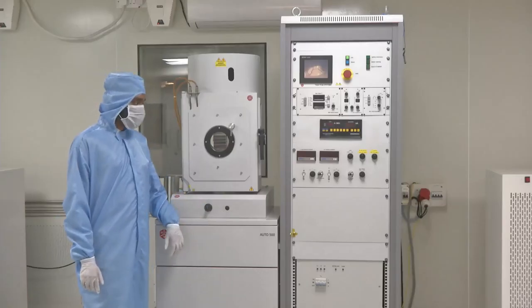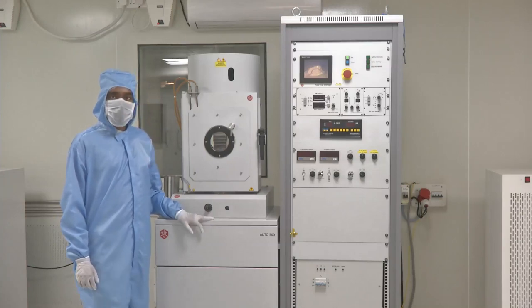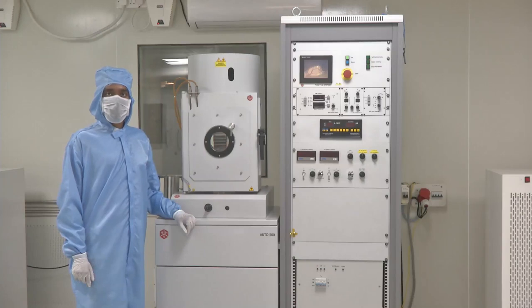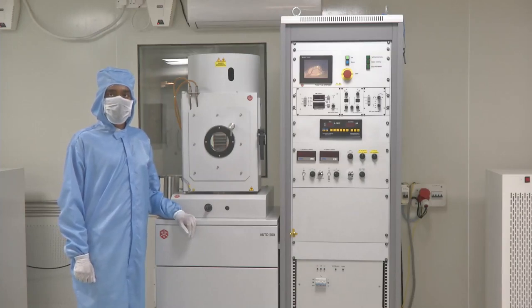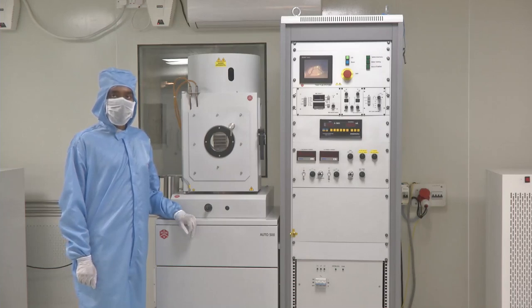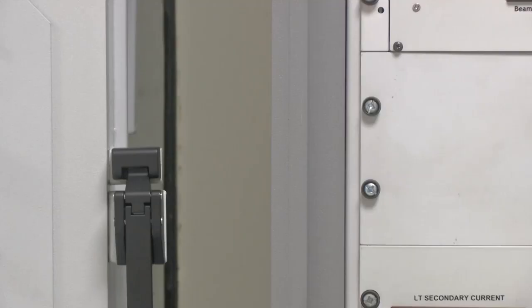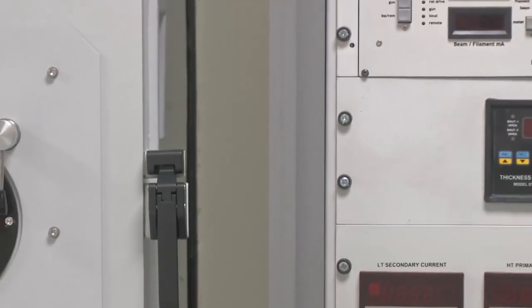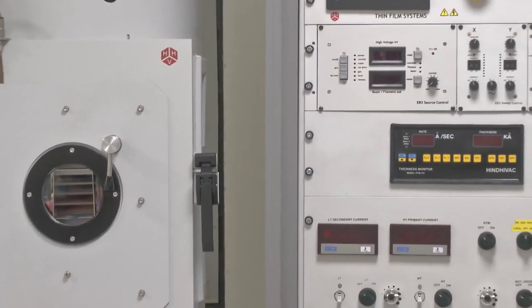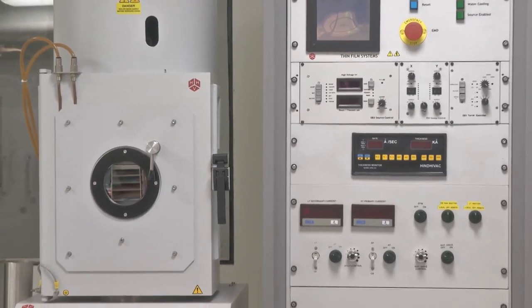Hello everyone! Welcome to this session where we are going to talk about a tool which is very commonly used in a clean room environment. This is a class 1000 to class 10,000 clean room, and the tool next to my colleague is an electron beam evaporator. Today we are going to see how we can start the system, operate it, and bring it to the point where we can start the deposition.